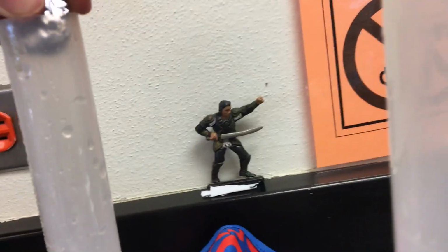I'd be happier if it fit in there. All right, this one goes by 5, so I'm slightly worried we're not going to get enough of a difference here. Let's see if I have a bigger one.